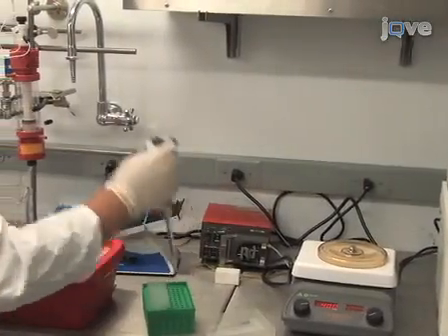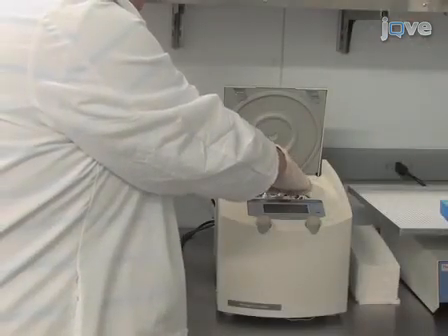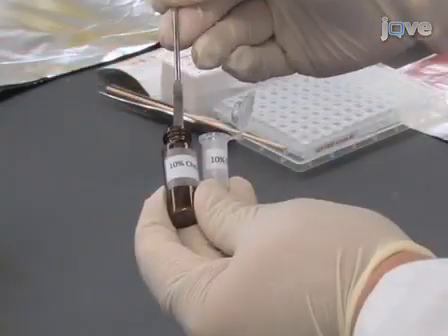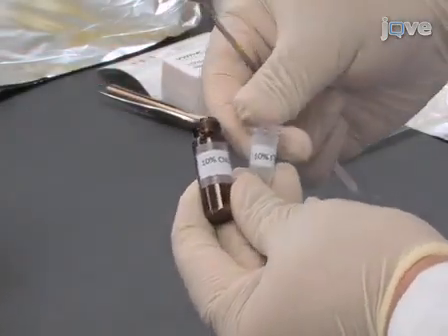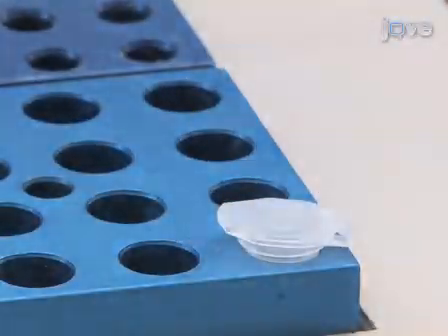Purify membrane protein of interest in a detergent solution and concentrate the protein detergent complexes to approximately 10 to 20 mg per milliliter. Transfer about 25 mg of a LCP host lipid or a lipid mixture into a plastic tube and incubate at 40 degrees Celsius for a few minutes until the lipid melts.